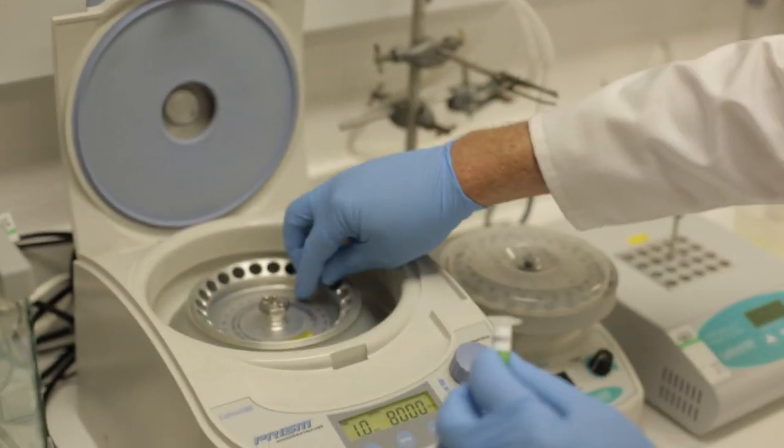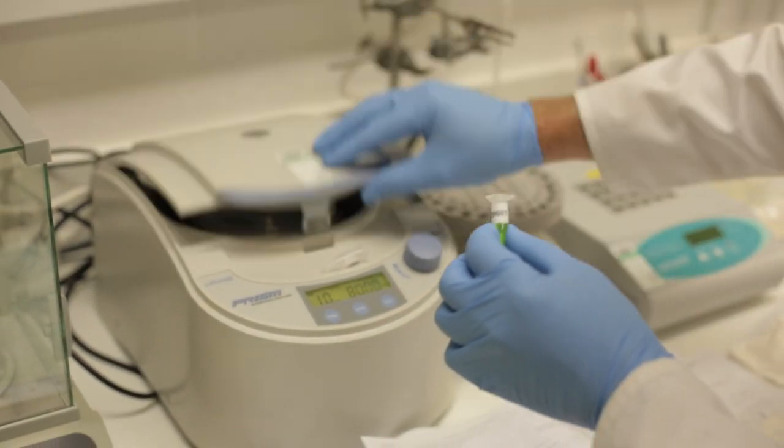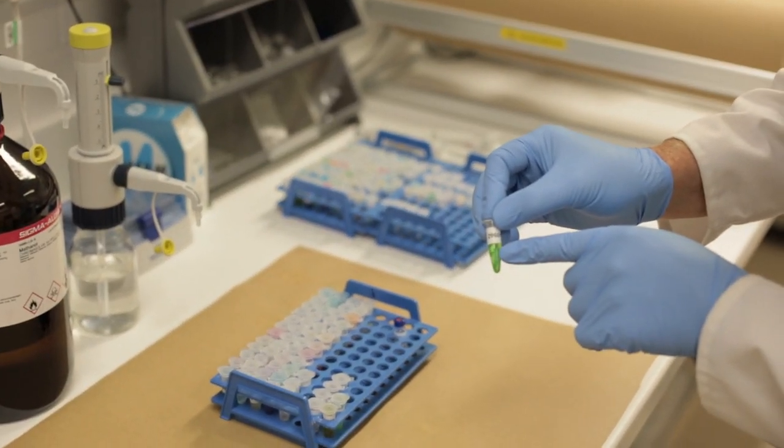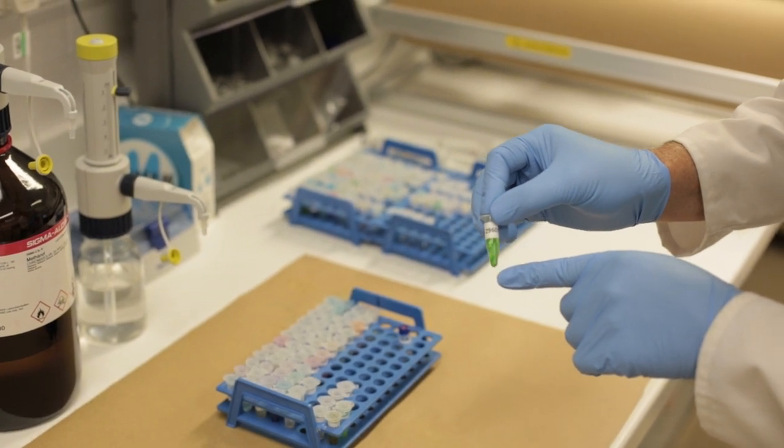So now we can take our tablet solution out. And what we have now is a methanol solution of the drug and all the insoluble material left at the bottom of the tube.